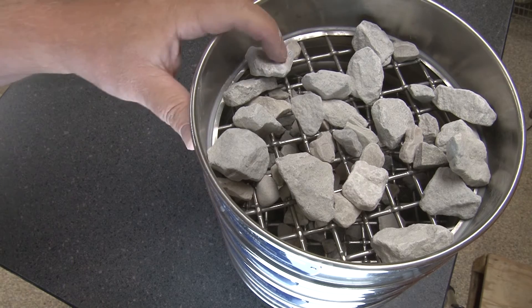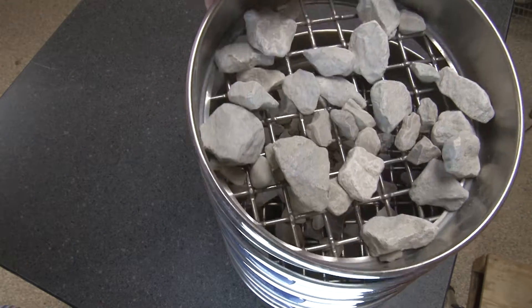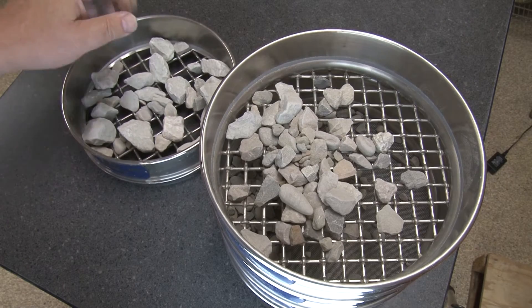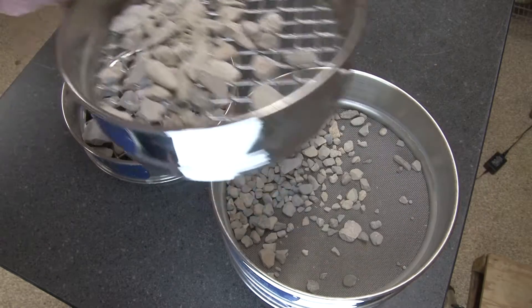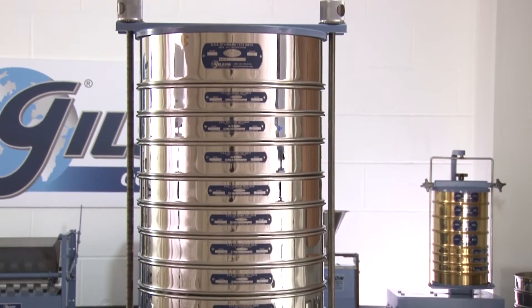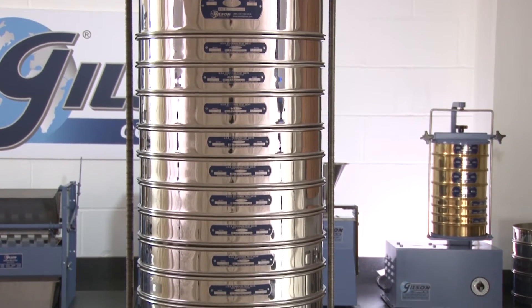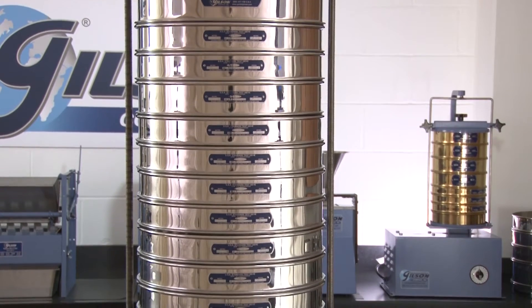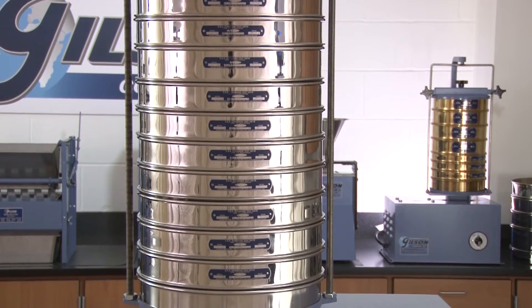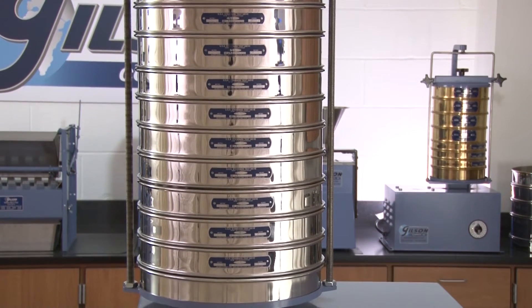Consequently, gradation analysis of coarse particles requires a full-height test sieve. On the other hand, half-height test sieves allow a greater number of sieves in the sieve stack, thereby allowing more separations in the same vertical space when testing finer material.